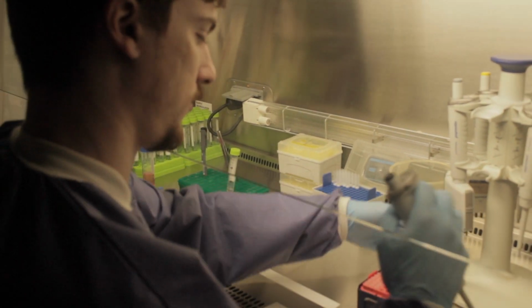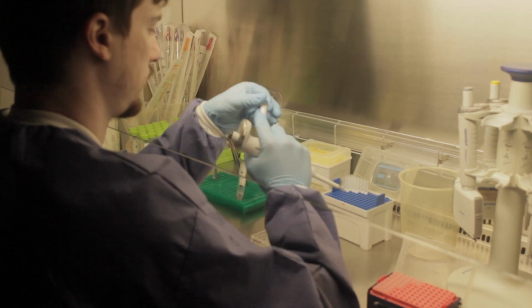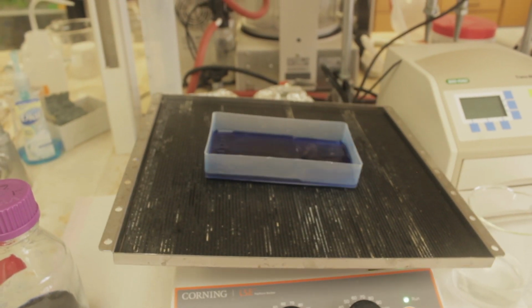These assays provide valuable insights into cellular health, allowing us to track toxicity on an organelle level and understand how protein aggregates affect cell well-being. Join us as we explore the mysteries of neurobiology and work toward finding solutions for neurodegenerative diseases.